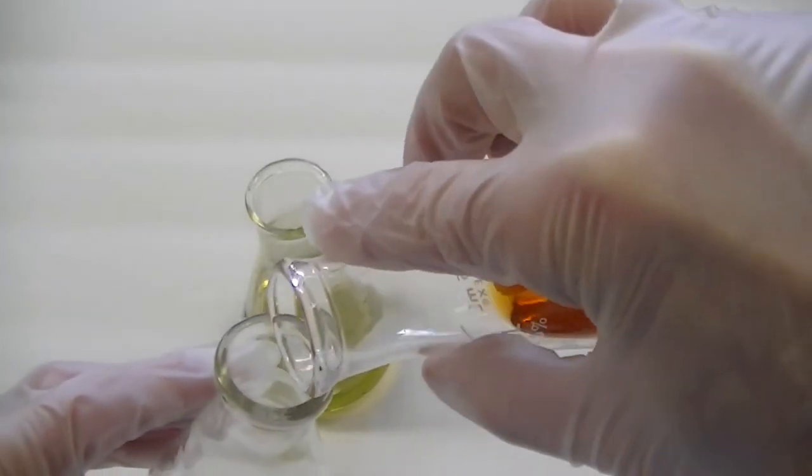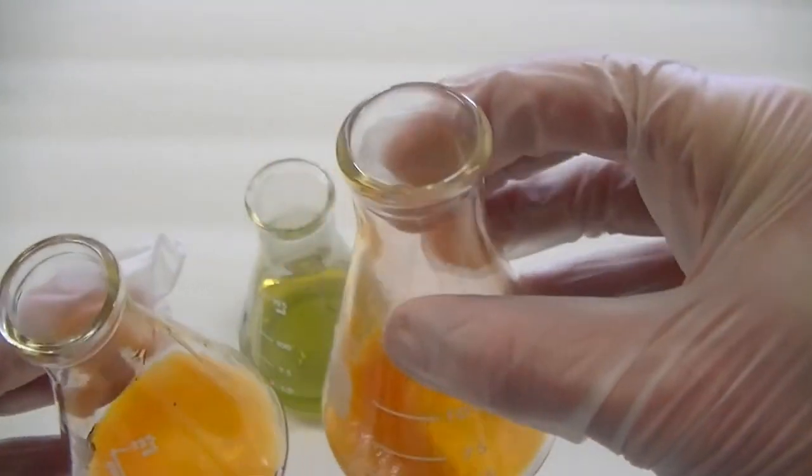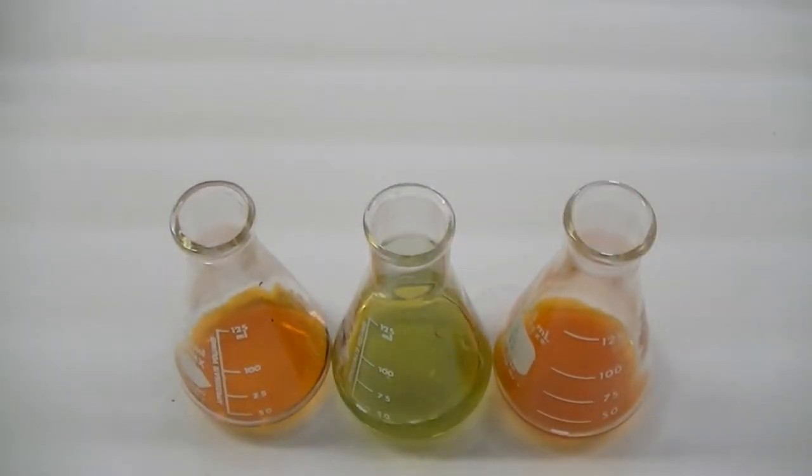Now let's see what happens if we take some of this solution containing the orange tetrachloro-copper solution and add some water to it.